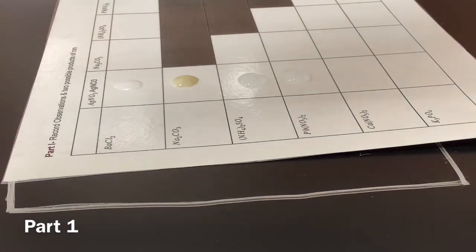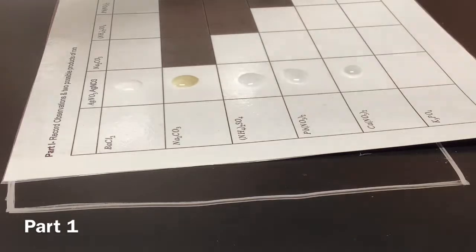Okay, nothing. So we're going to the salt. This better be Ca and not Ga, because if it's Ga, that would be sad. Yes, Ca(NO3)2. So we're doing the calcium nitrate here. I don't think she has gallium. That'd be kind of scary. And then with the AgNO3, the Fe.